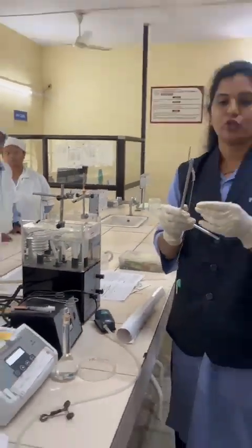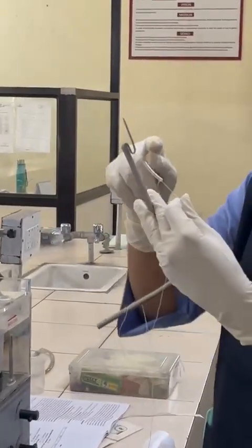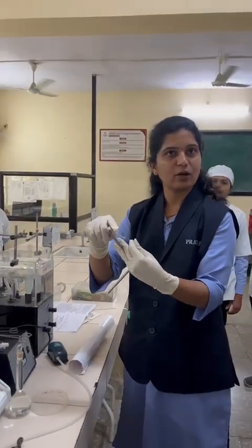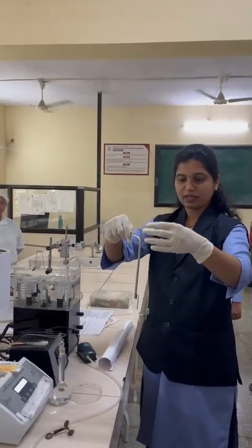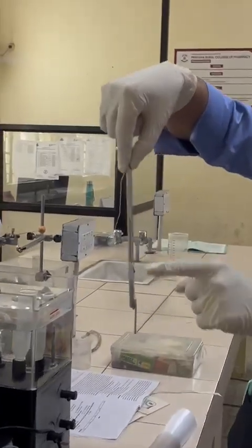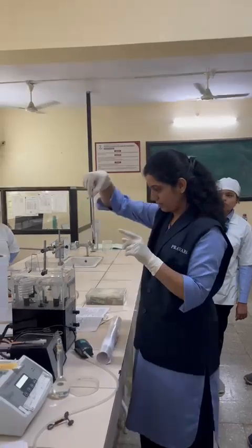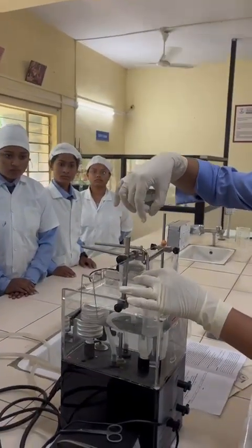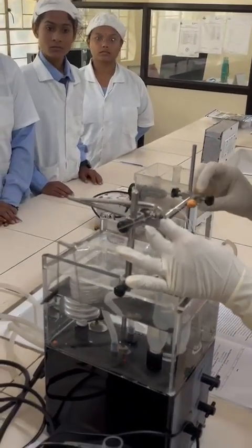Here the aerator tube is there. After attachment of the thread to the tissue part, we have to attach the smaller part to the lower side of the aerator, and in the longitudinal way there will be the second thread, parallel to this aerator. Likewise we have to assemble this tissue on this organ tube. We have to put it here. With the help of this holder, we have to hold the aerator tube.